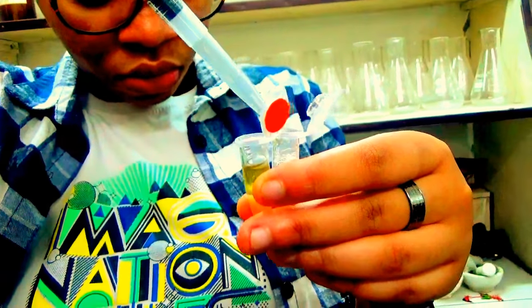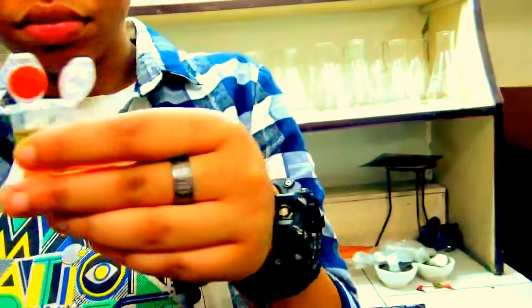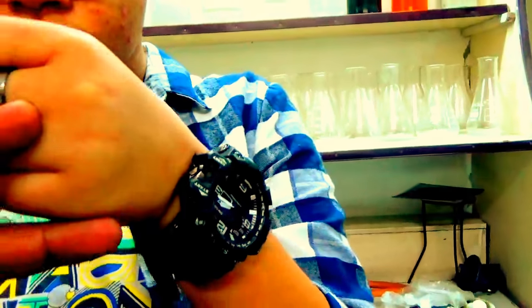Little more, dip the tip. Little more, dip the tip. Keep up to nose high. No. Mouth pipetting is not allowed, okay?